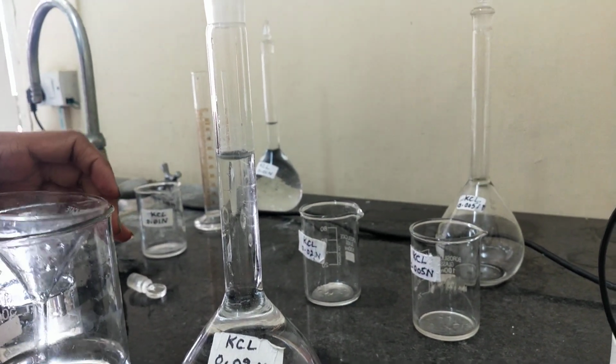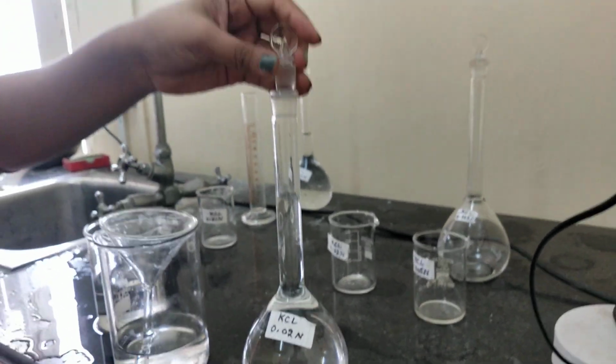So our solution is ready, of concentration 0.02 normal.